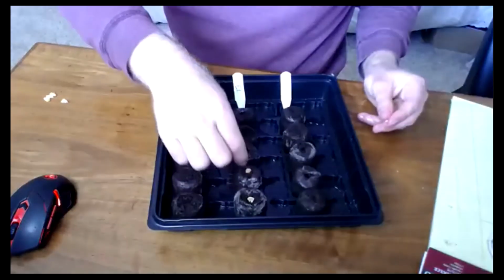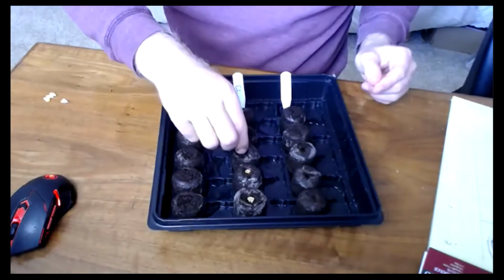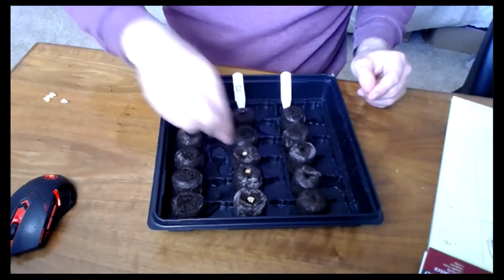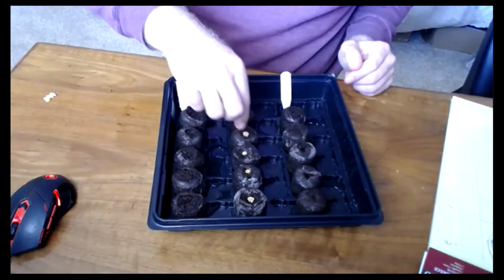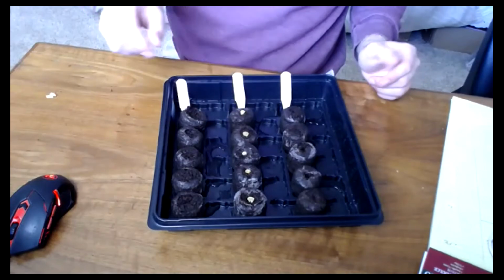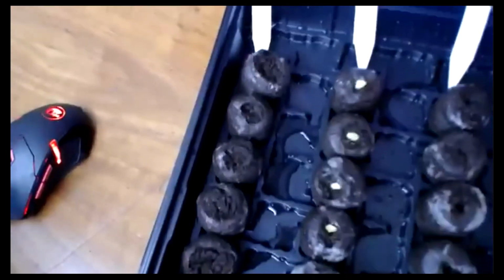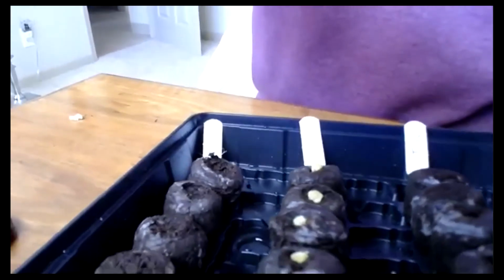Just kind of the pokey end down. So they're all set up pretty well now, I'd say anyway. Great. All right.